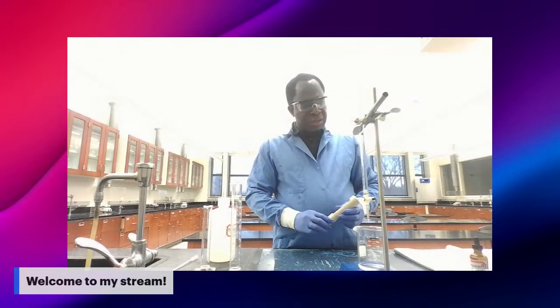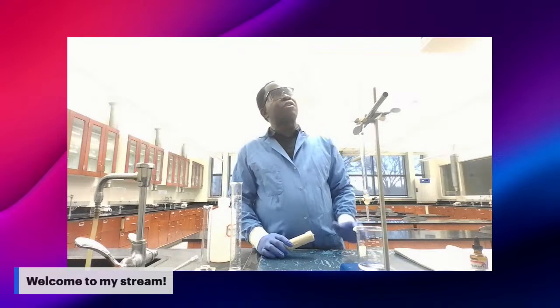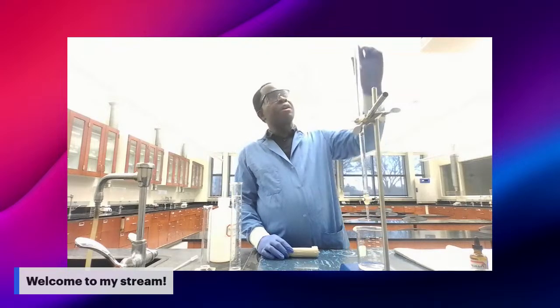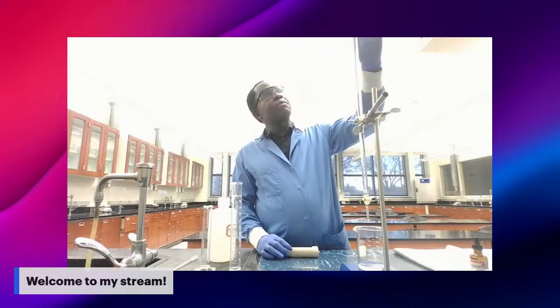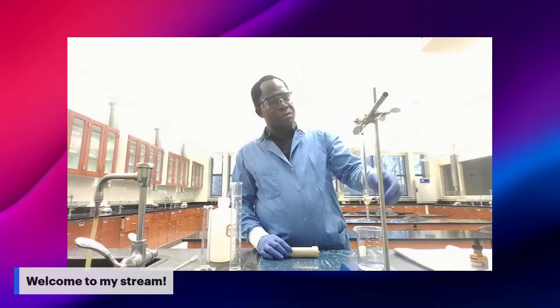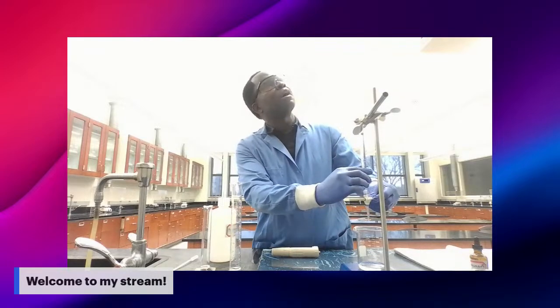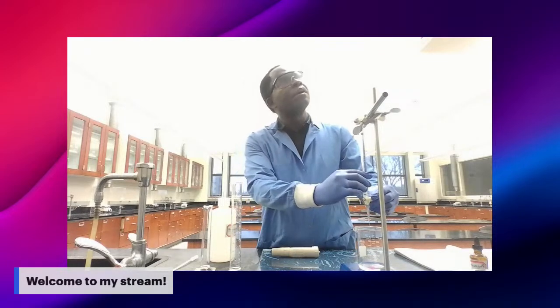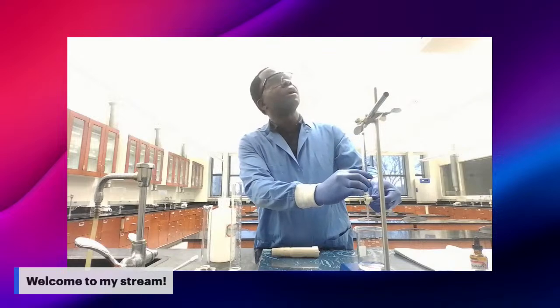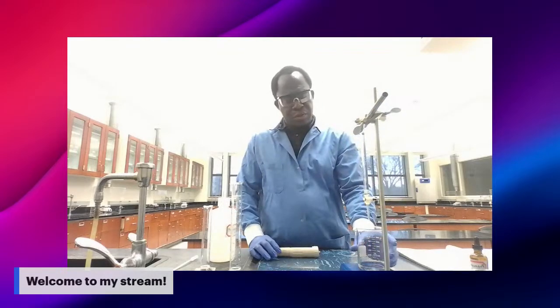This is how you're going to proceed. You're going to add the base in increments of 1 milliliter. So this is what I'm going to do now. Just 1 milliliter, add it.